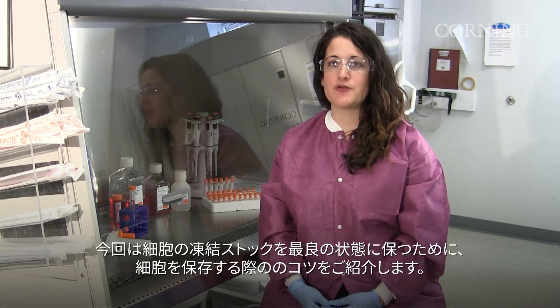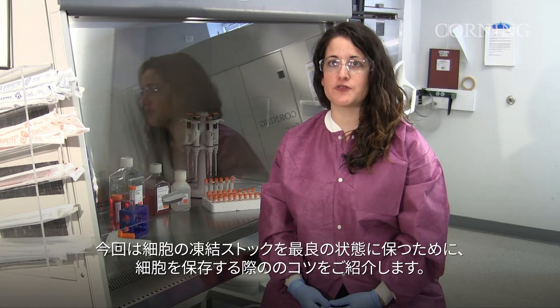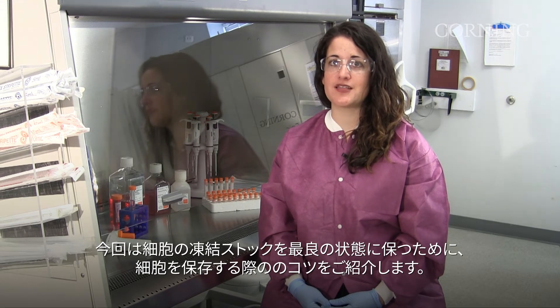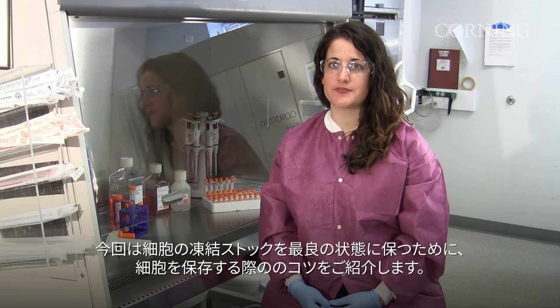Welcome to the fifth in a series of cell culture videos on storage. Today I will be sharing some tips and tricks for storing cells that will help ensure your frozen stocks are of the highest quality.